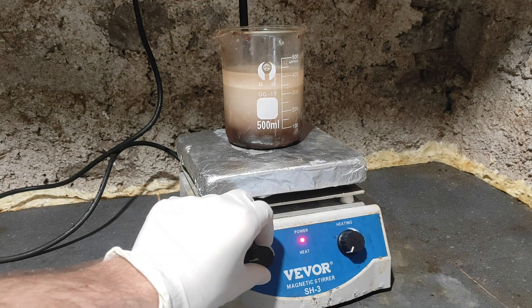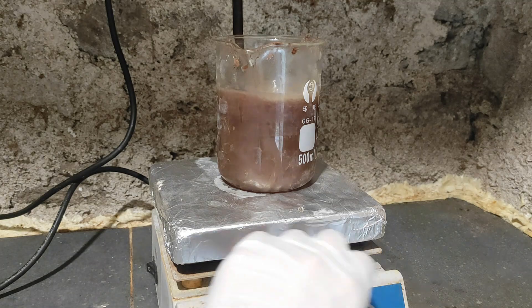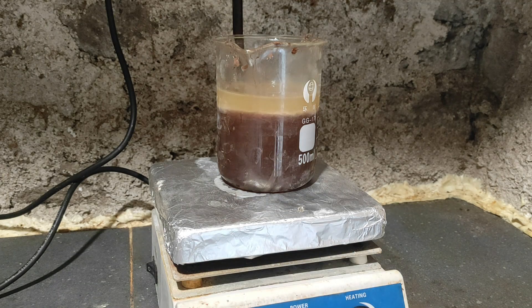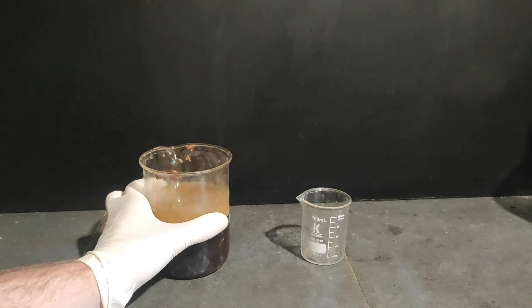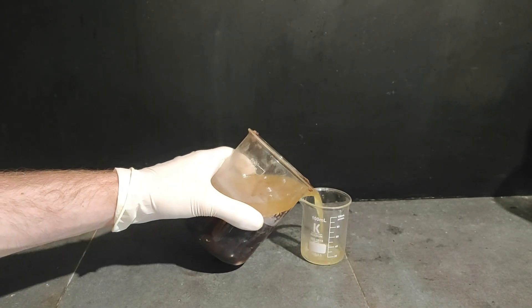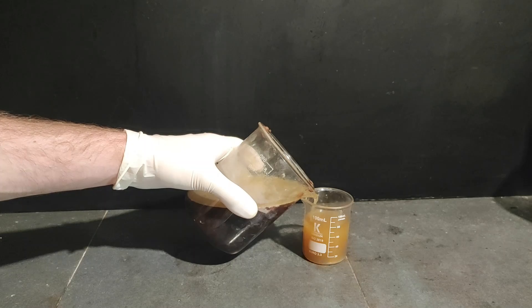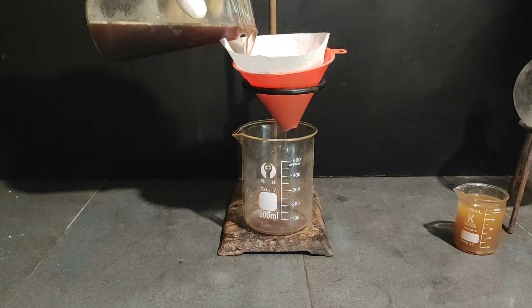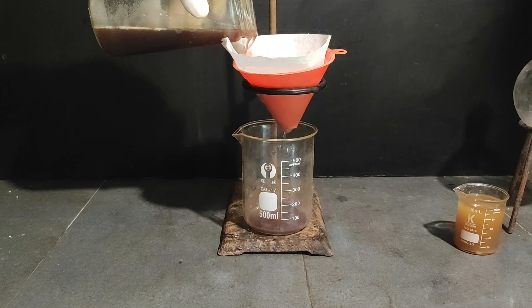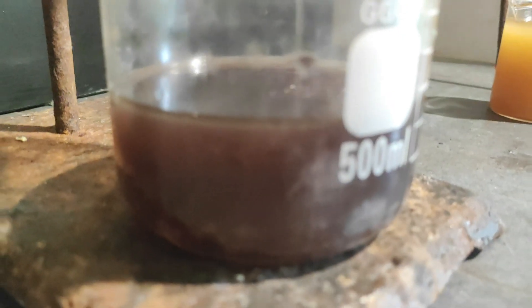I put everything on the hot plate to heat and dissolve everything nicely. Then I decanted the top layer, which is the toluene, and filtered the water layer containing our product to get rid of the insoluble impurities, which is probably the real tar. As you can see, there is a lot of junk on top, and even though the bottom solution is dark, at least it's somewhat clearer and doesn't have so much of the junk.